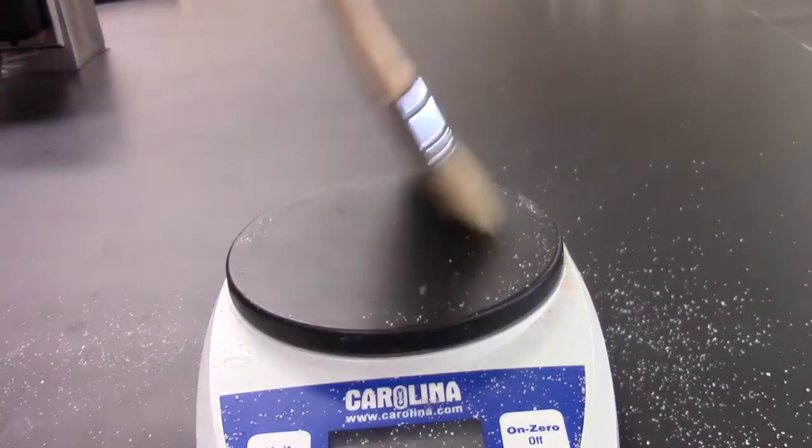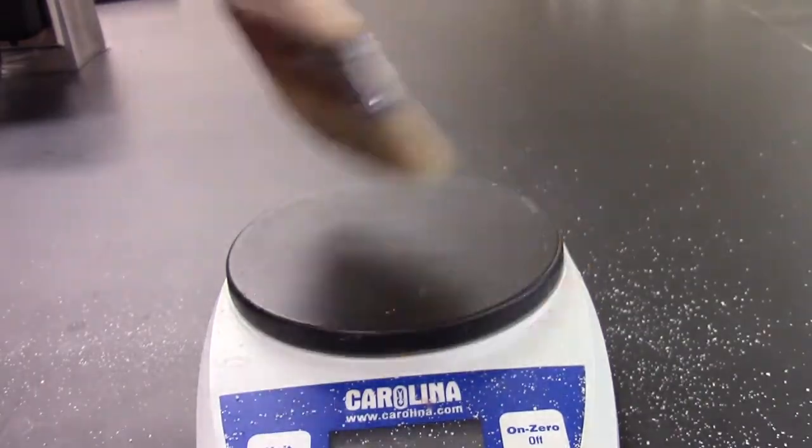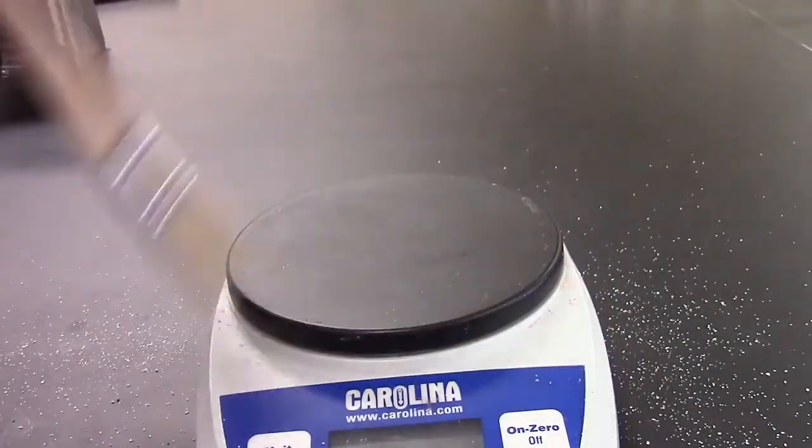It is important to turn off the scale before you clean it so you do not damage it. Now that it is off, you can clean the top of the scale using a brush like this one. And just like that, you have learned the proper procedure to use the scale. Now you can keep everything balanced, just as it should be in life and the food chain. Congratulations!